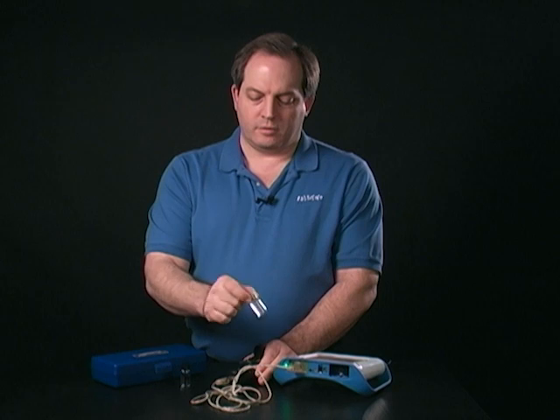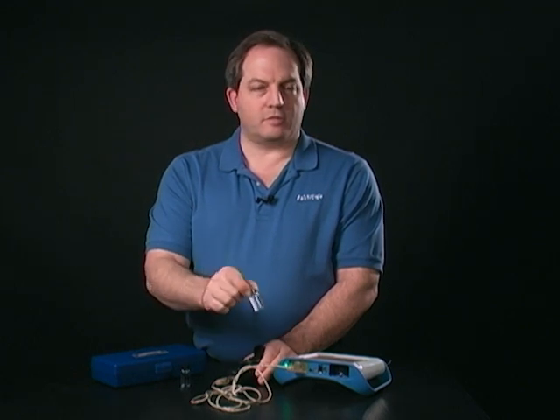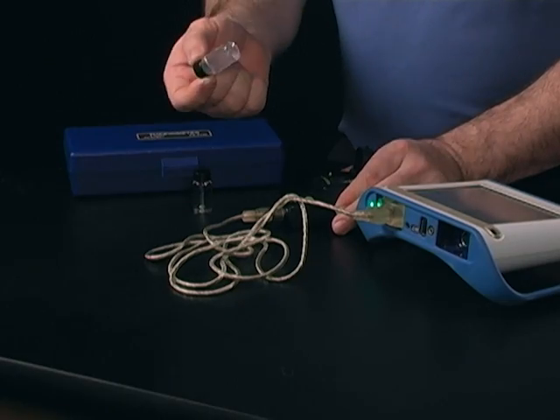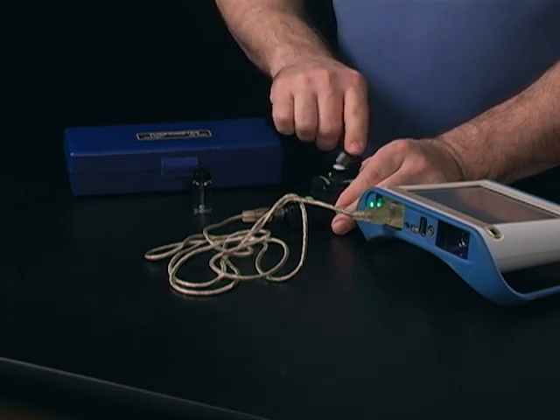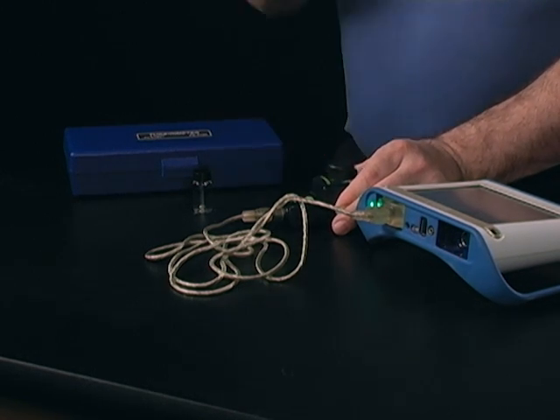I'm going to go ahead and stir that up just a little bit — I'm just going to gently rock it back and forth. I don't want to actually shake it. I'm going to go ahead and put that into the turbidity sensor and press the button one more time.